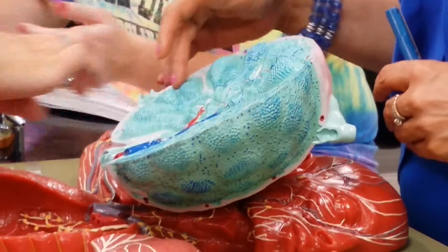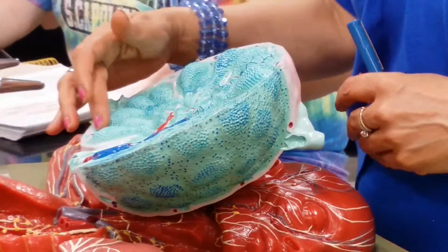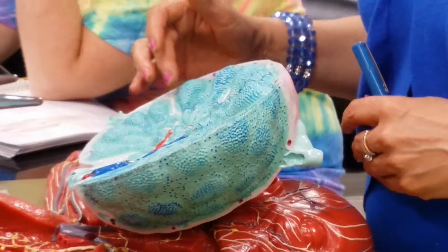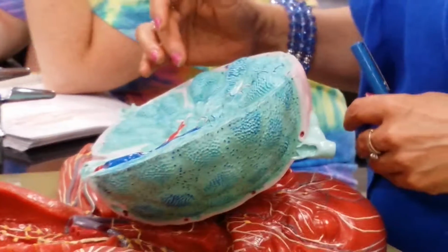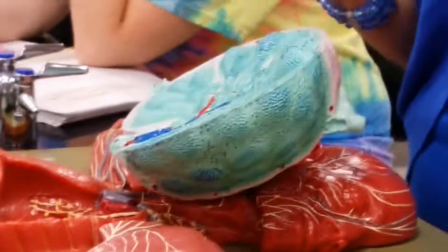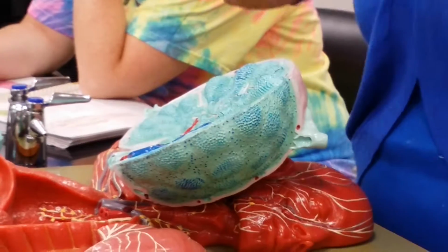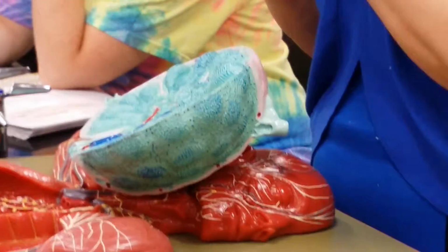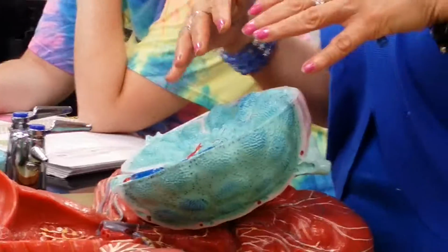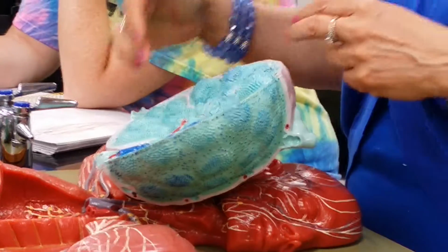So what's the difference between these, if they are subcapsular? Which one did you say was lymphatic sinus? They're all lymphatic sinuses. Lymphatic sinus means the sinus is in the lymph node, right? Very much like tonsils, they're all tonsils, and then they come in 3 types by location. So they're all lymphatic sinuses, and there are 3 kinds of them based on their position.